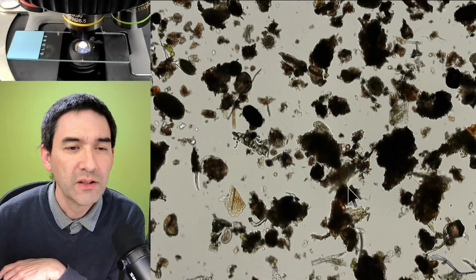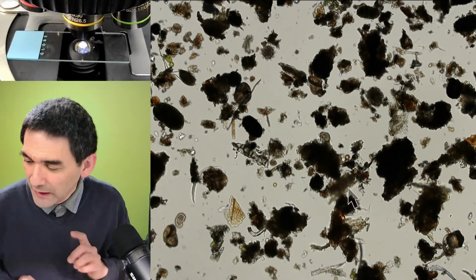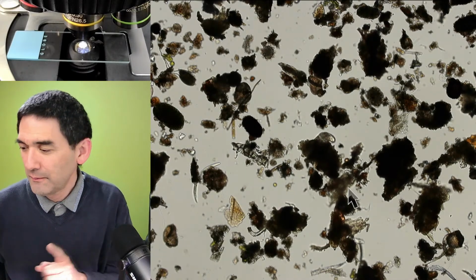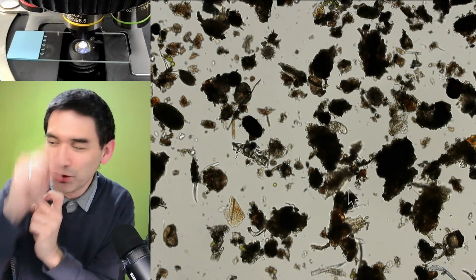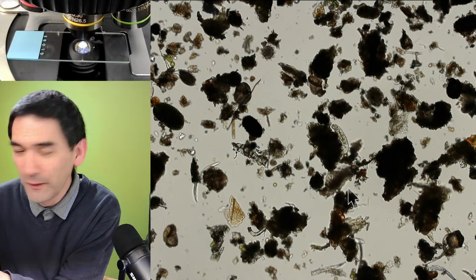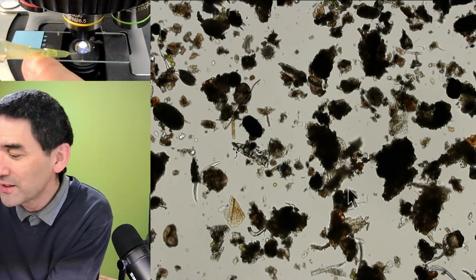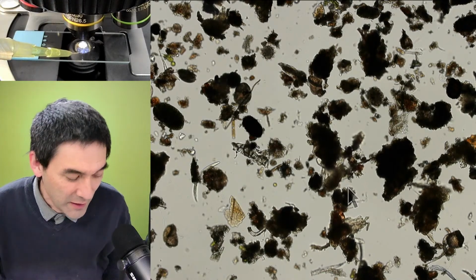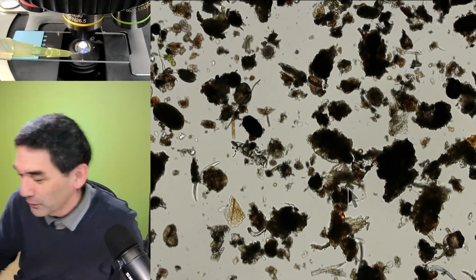But what I would like to do now is show you something else that I've made, and now watch this. What I have at the top. Watch the stage, because I'm going to move something into the stage now. Here it is. What do you see? Does this look a little bit like a highly improvised micro manipulator? We've been talking about this already.